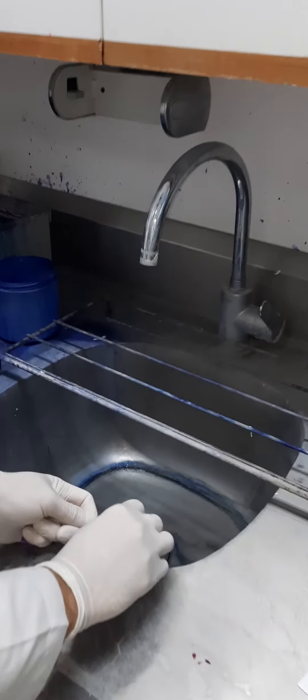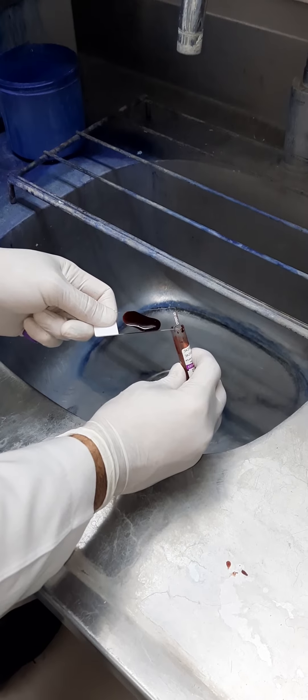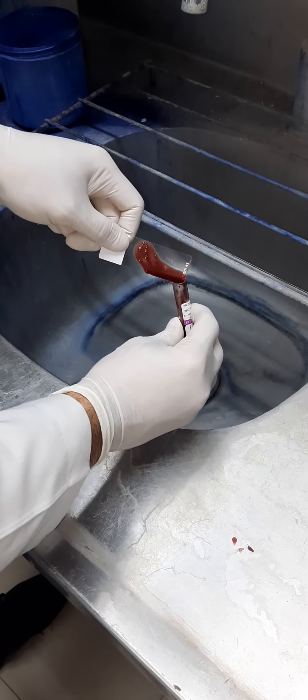Then we have to pour a little bit of the sample on the slide and let it settle down, then pour out the blood component.